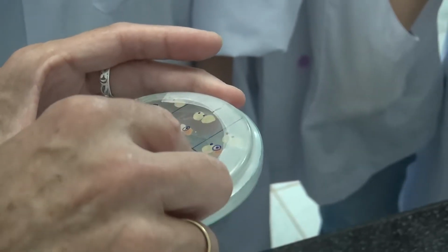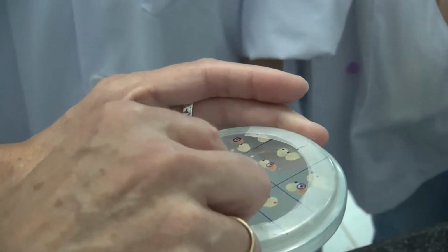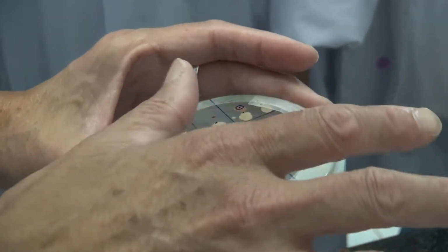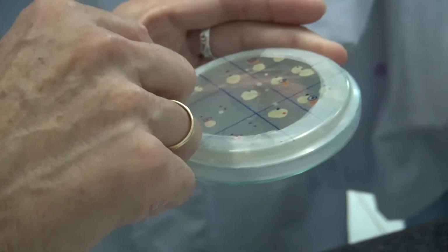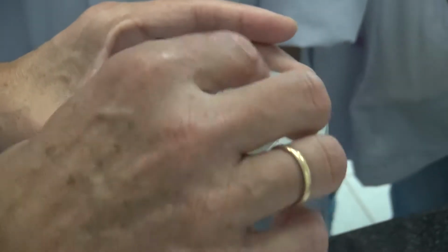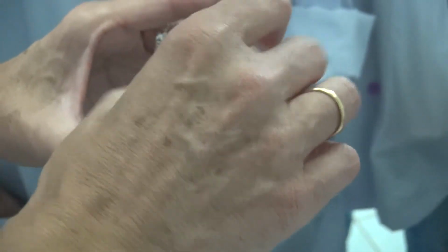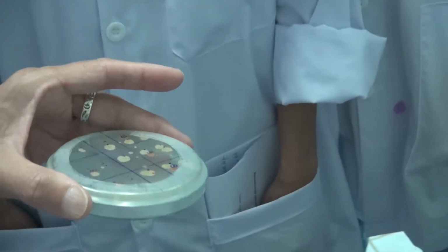Well, again, maybe the actinomycete didn't grow here because it's not enough time. Maybe the copiotroph grows very, very fast and just depletes the nutrients around or produces some substance, because there are so many of them, that the actinomycete cannot grow. Because here you have the actinomycetes, some of them grew. So when you do this kind of experiment, this is just to show, but you have to take more space and time.